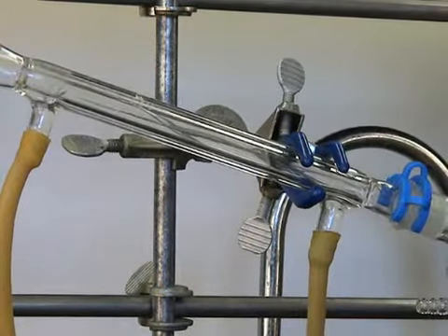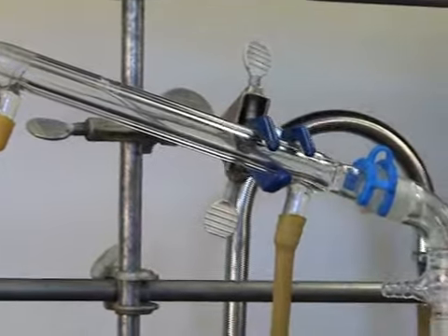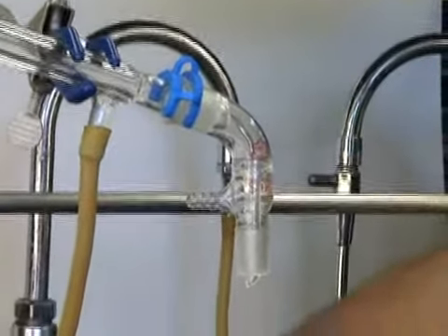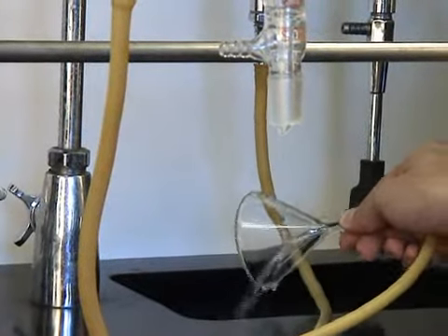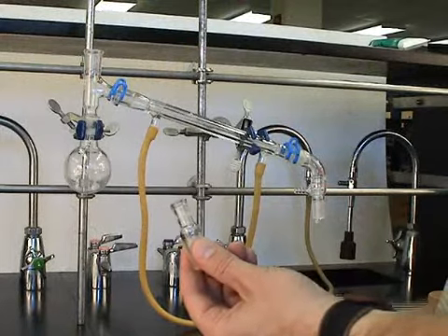And then gently turn on the water. You'll see the condenser fill up. In order to check the flow rate, we have to lift the funnel up and look at how fast the water is flowing out of the end of the hose.